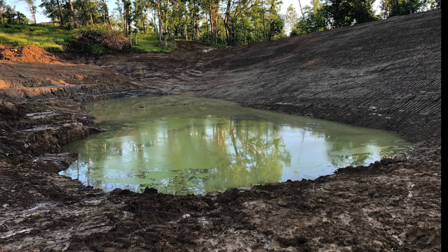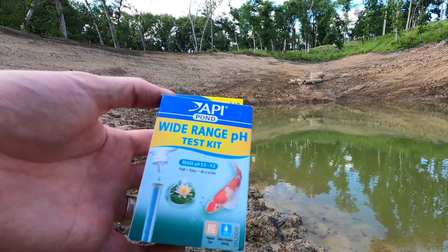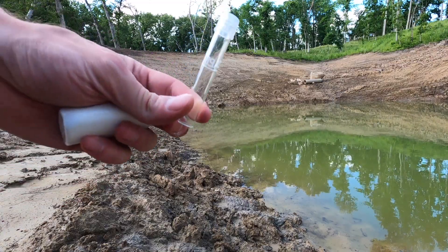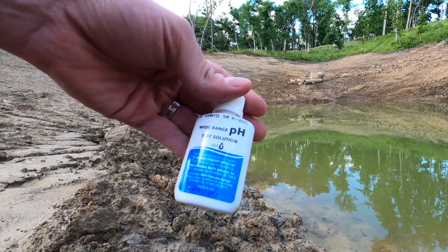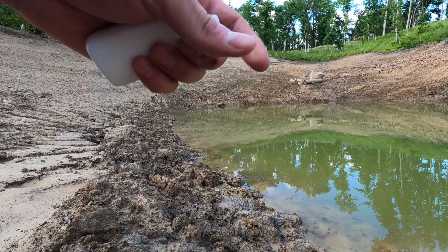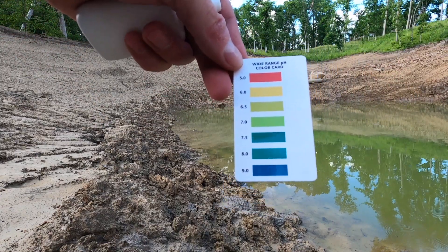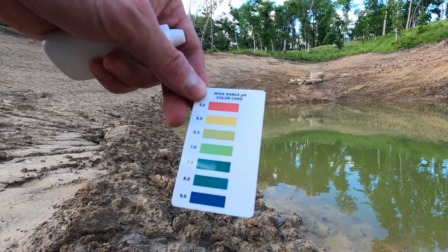We need to figure out our pH balance of the water first. So I got this test kit on Amazon. Inside there's a 5ml test tube and pH solution. You add 5 drops to each 5ml, and then we're going to measure it against this card before we put any kind of fish in here to determine whether we need to treat the water.